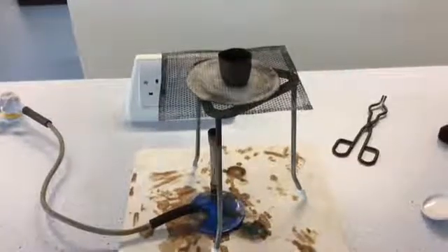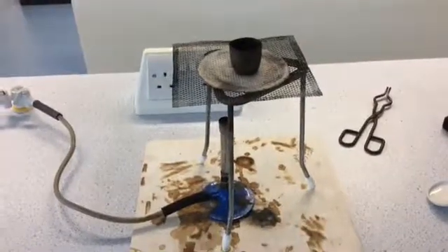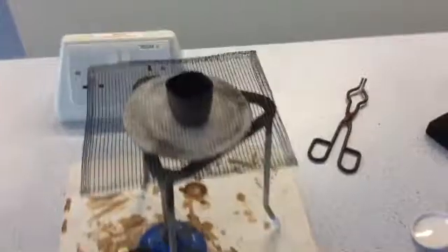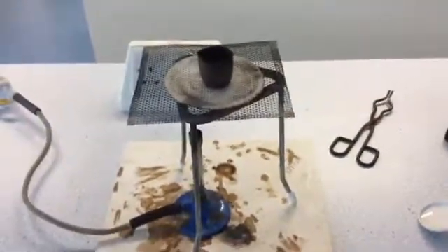This means that the original mass of my magnesium is 0.1 grams if I take away the mass of the crucible. So I've set up my equipment, I've got my Bunsen burner, my tripod, my gauze and on top I've got the crucible and inside the crucible is my magnesium ready to be heated so that it will burn with oxygen.